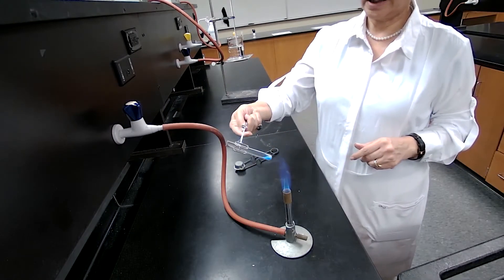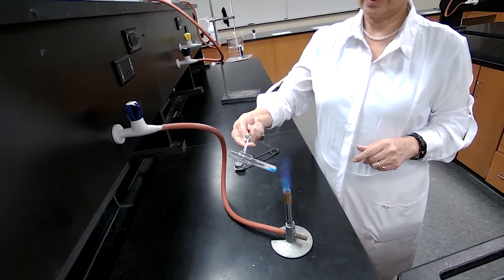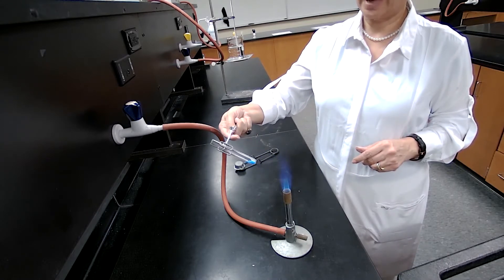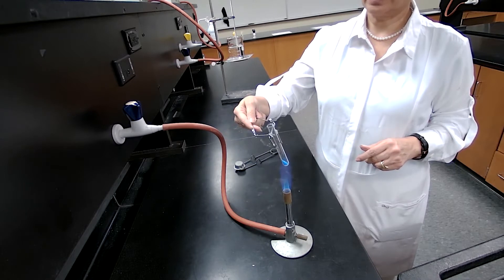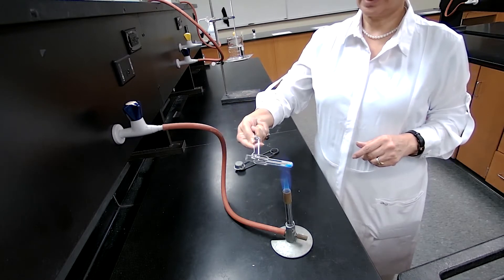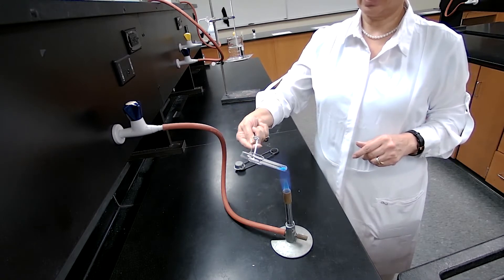Second, you want to keep the test tube with a 45 degree angle. You don't want to keep it straight. Third, you want to keep it in and out of the flame.